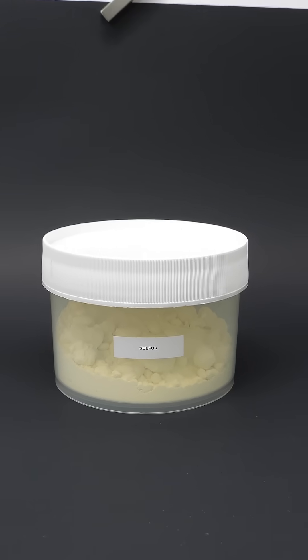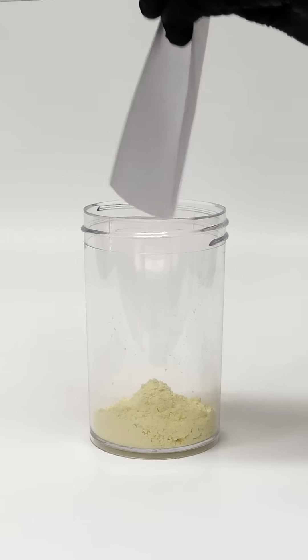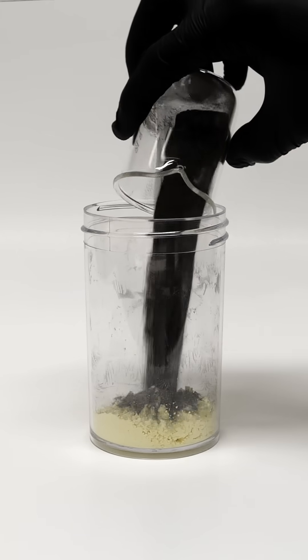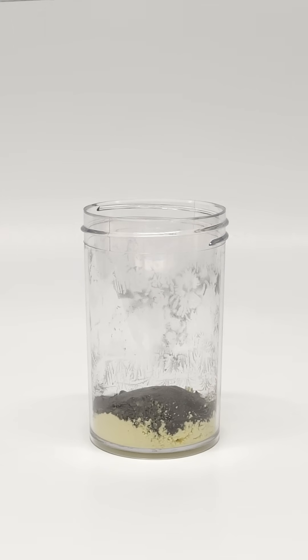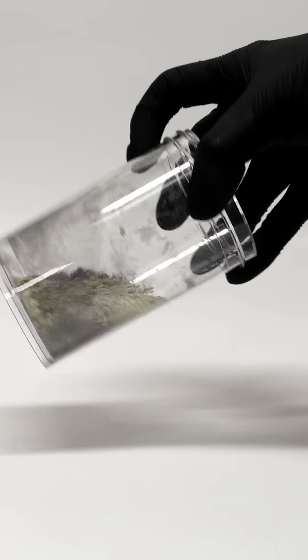I've decided to do one of my favorite reactions and the first thing I need is some sulfur. I'll add about 20 grams to a little container. On top of this I also need to add some powdered iron metal — I measured out about 35 grams. This mixture can be a bit unstable and stirring it normally can sometimes cause it to go off, so instead I'll just carefully shake it around until it looks evenly mixed.